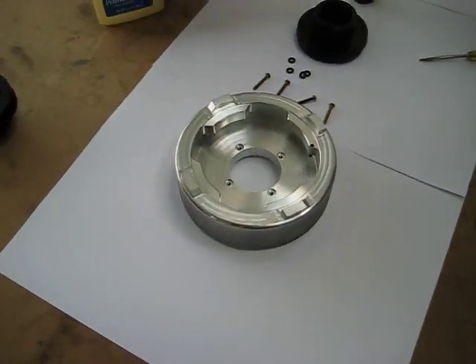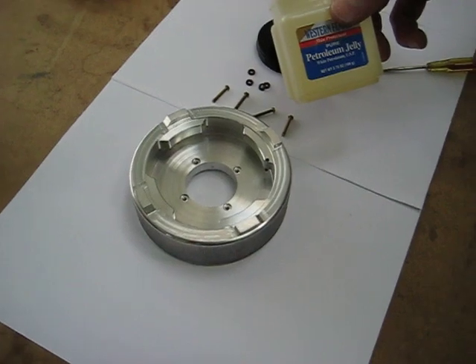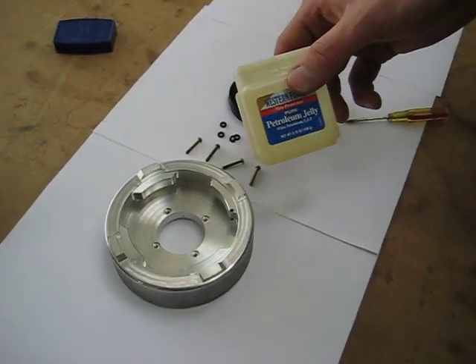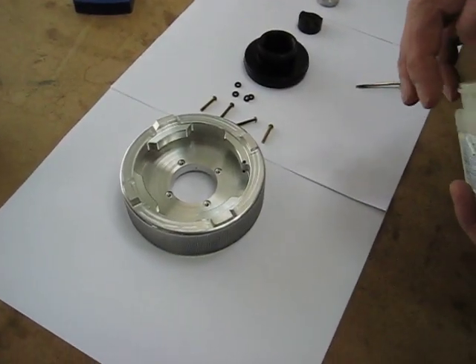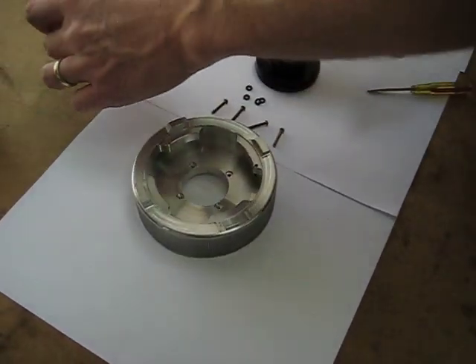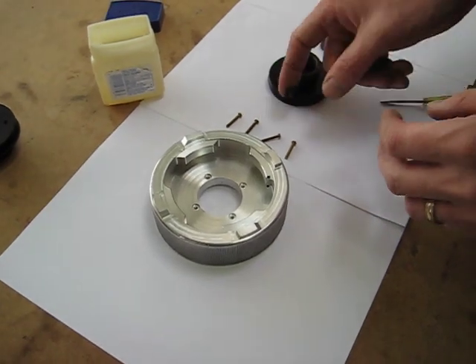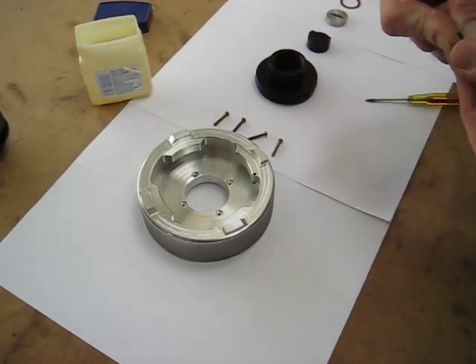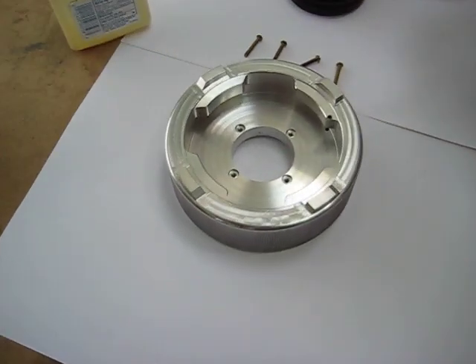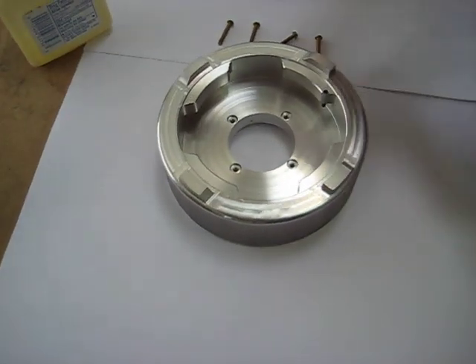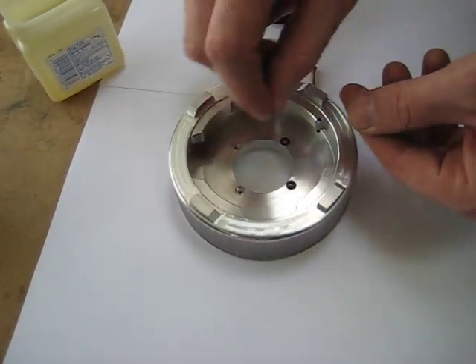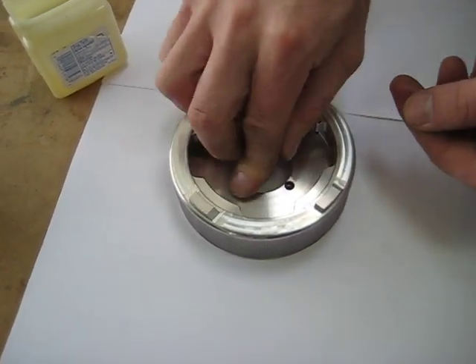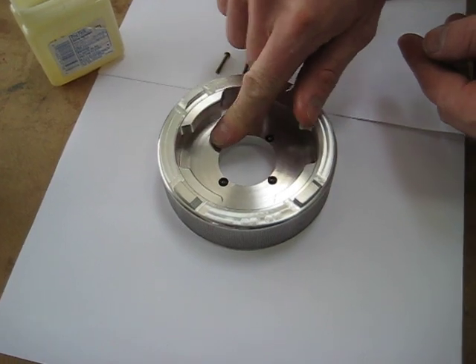The first thing you want to make sure is the O-rings are in properly, so we're going to lubricate them a little bit with a tiny bit of Vaseline. Each O-ring will be placed into the four recessed holes. Just make sure that the lid's been cleaned out properly.